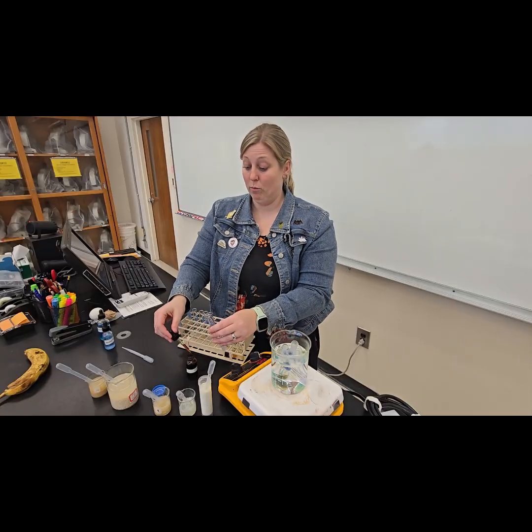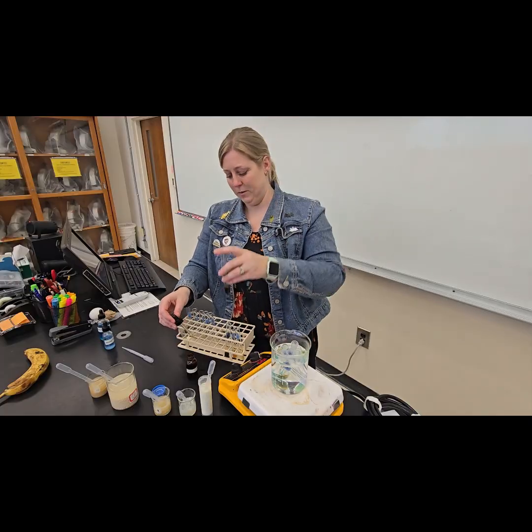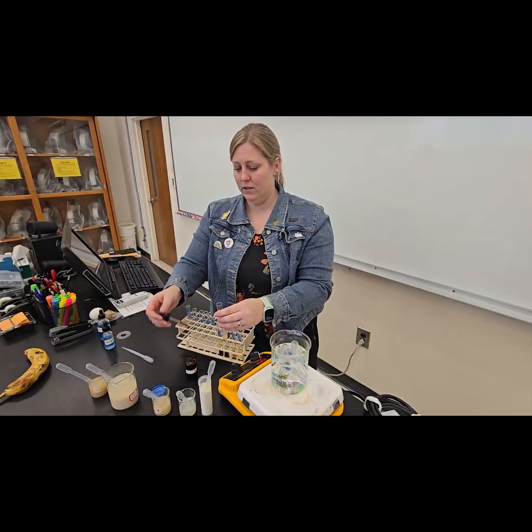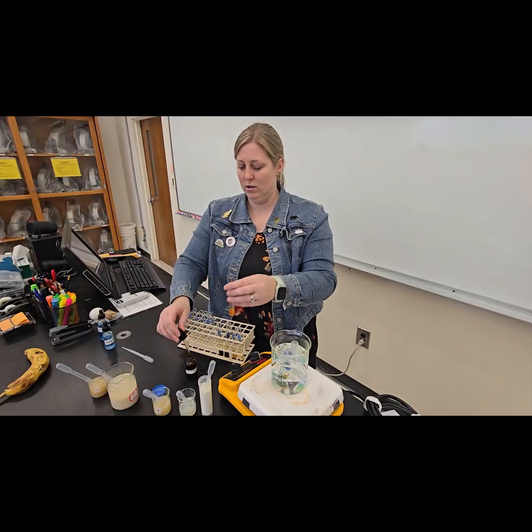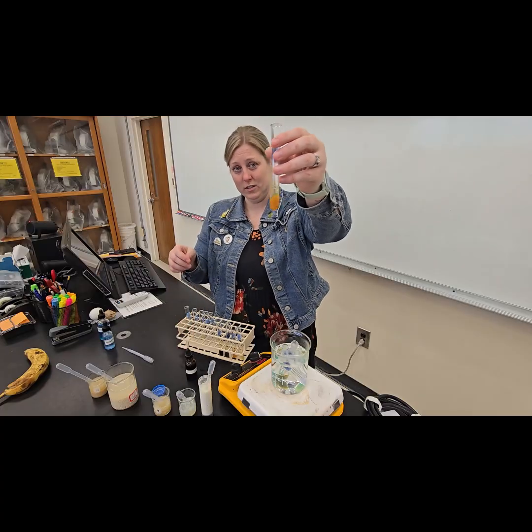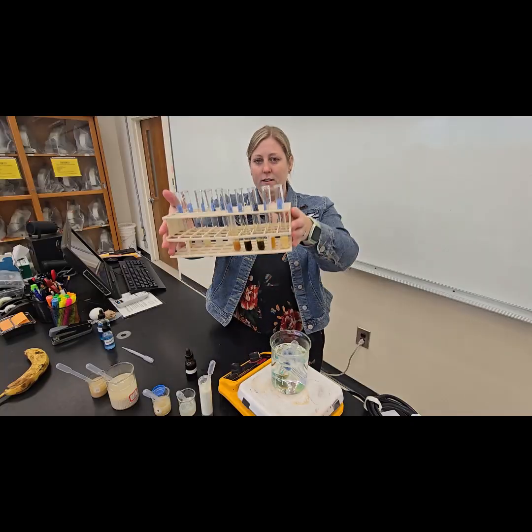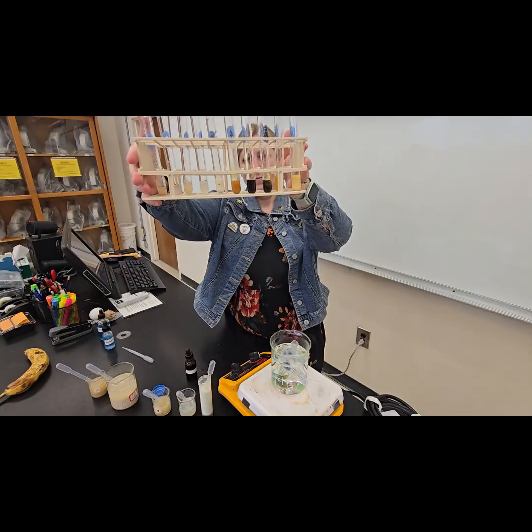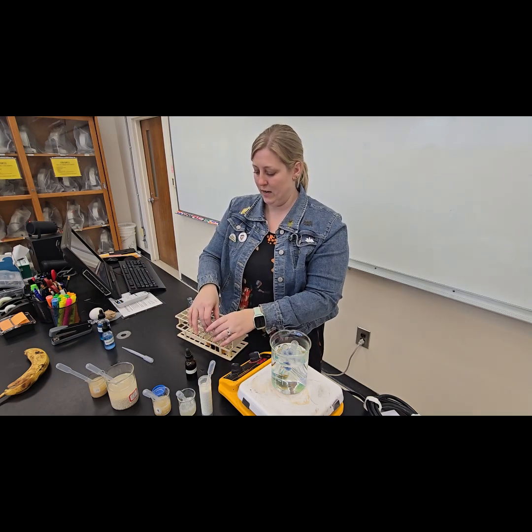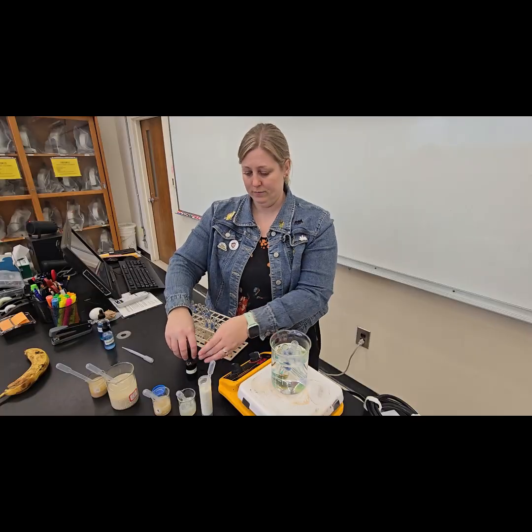iodine in our rice water. Okay, so rice water, and then iodine in our unknown. Let's see if there's any starch in our unknown. All right, so there are our color results for our iodine test. Again, here we got those right up there, and they're in that order. So milk, egg white, banana, rice water, and unknown.